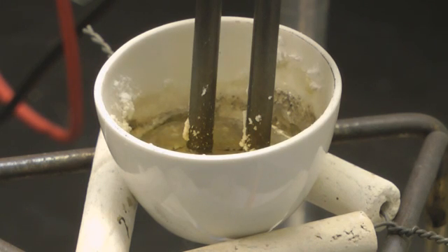As the current passes through the circuit, the lead bromide is broken down into lead and bromine. Here you can clearly see the formation of orange bromine vapour.